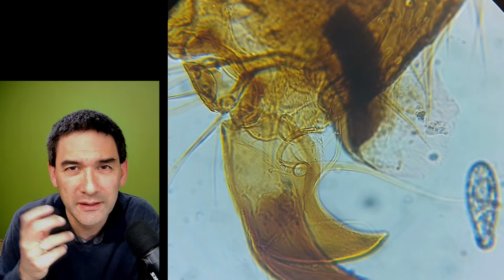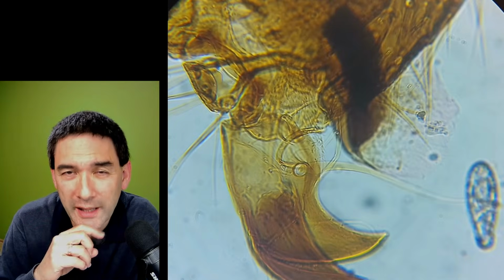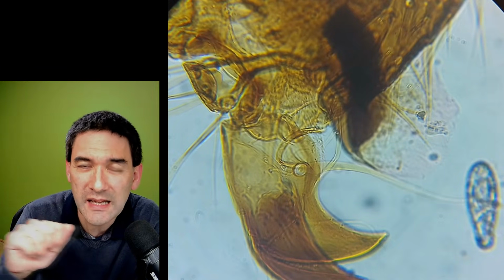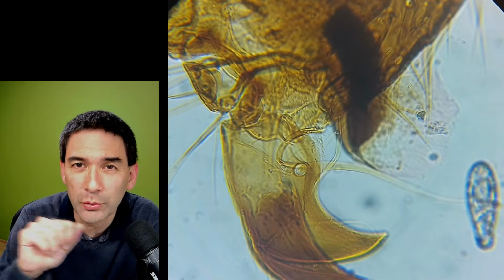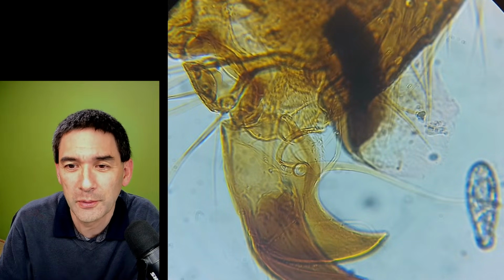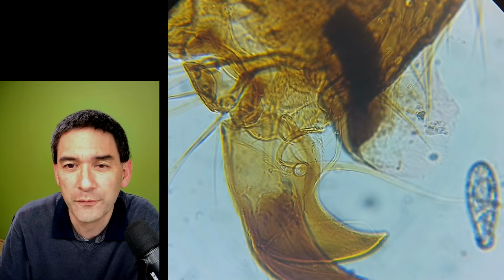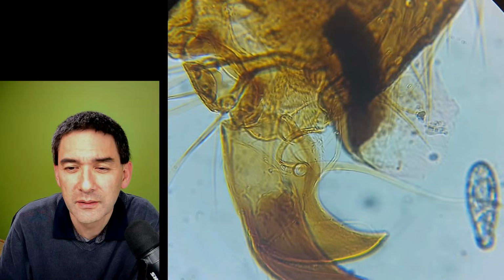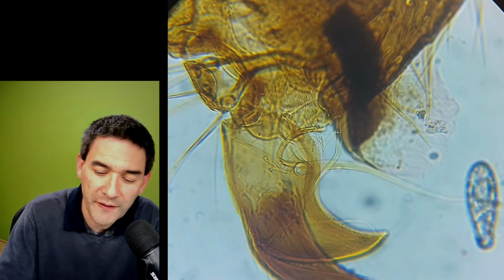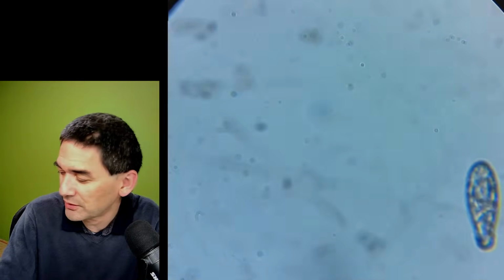One could try out an inkjet or a laser printer, print on overhead foil, and put that under the microscope, like microfiche or microfilm. I don't know if you've got 1200 dpi. That's not going to be enough.